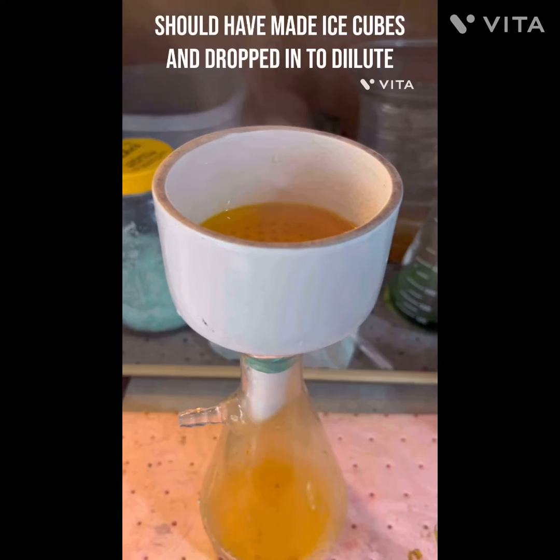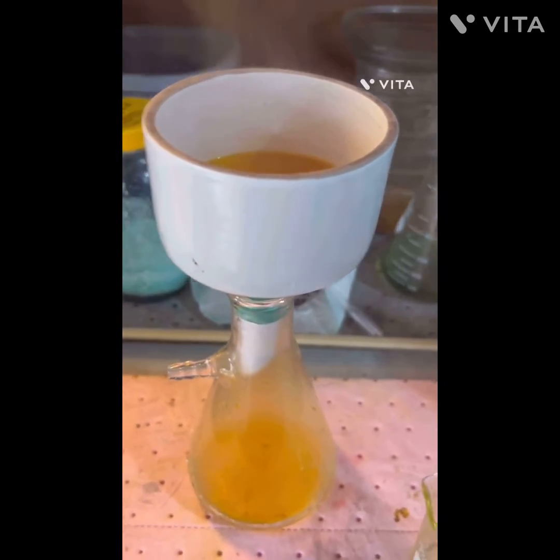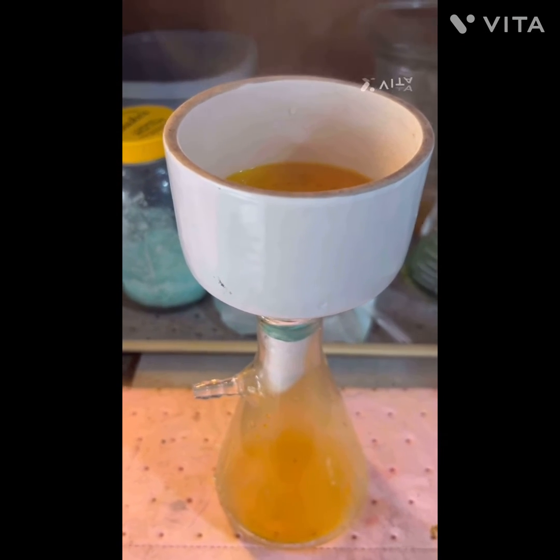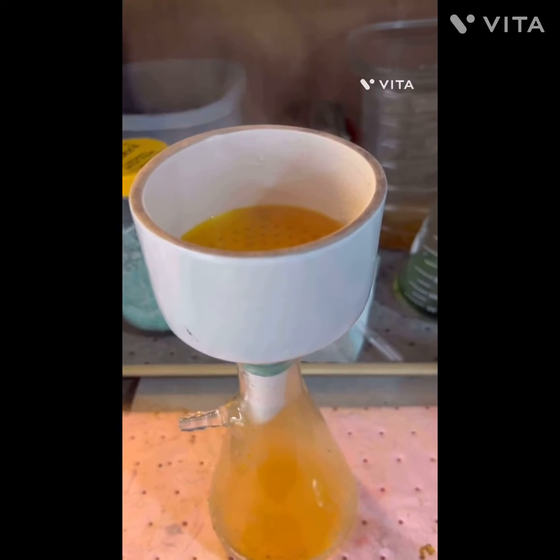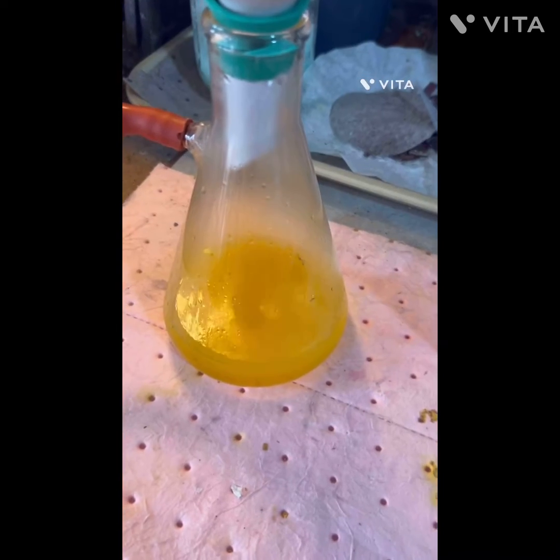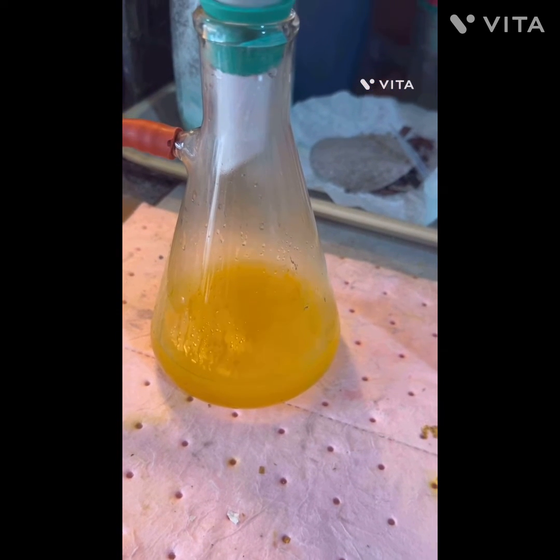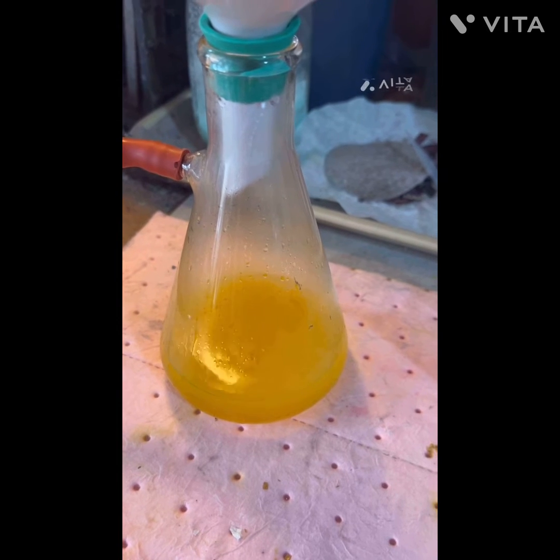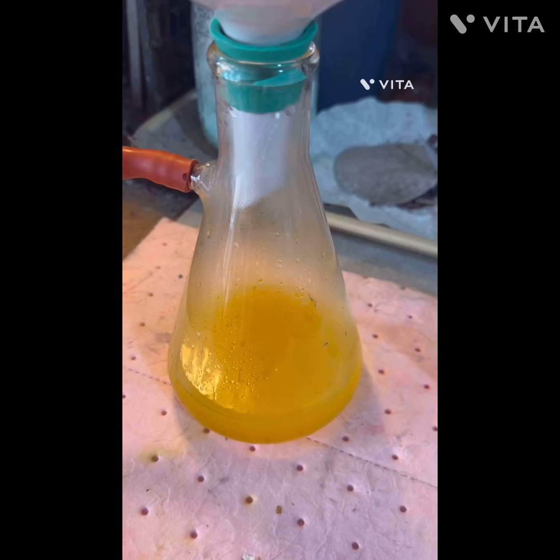Here we are filtering the gold out. We're going to dilute it and drop that ferrous sulfate. It's going through the filter pretty well - I don't even know if I need the vacuum filter right now, but we'll probably turn that on in a little while. All right, so we're on the vacuum filter - look at that color. We all love that color, right? We're going to drop it soon with the ferrous sulfate, the part everyone loves.